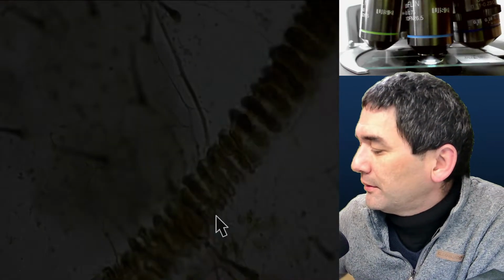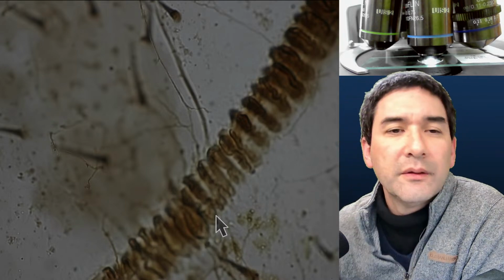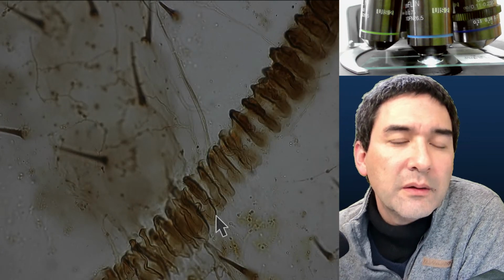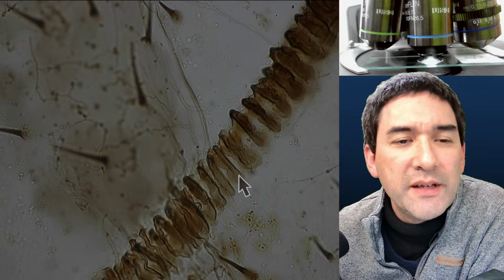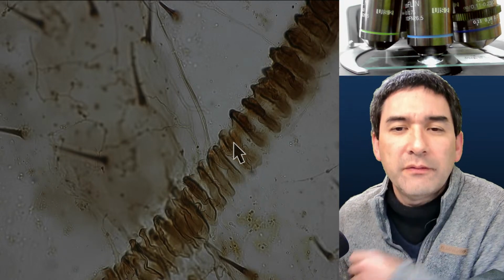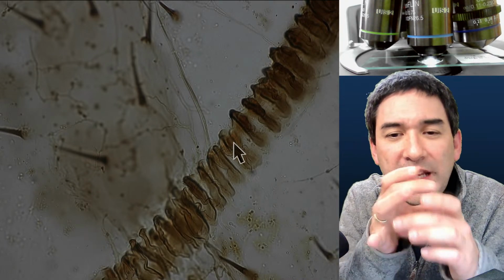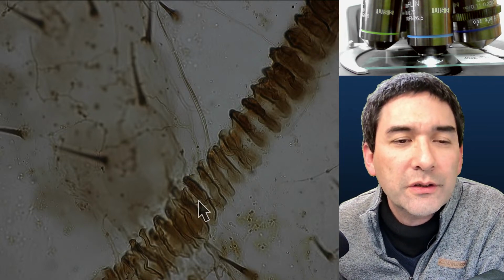Let's go up. I'm speculating a little bit. That could be a vessel over here, and those things over here that seem to be like we also have it here, going across like rings that kind of stabilize the structure.